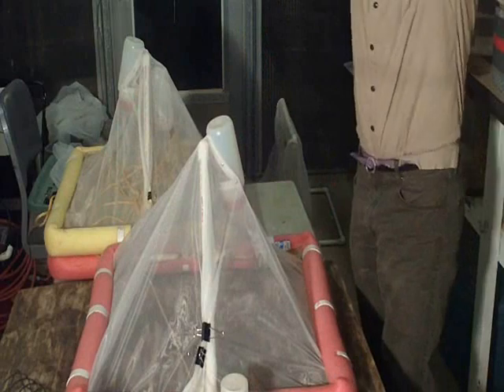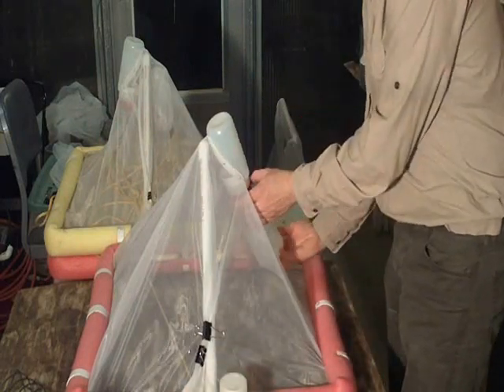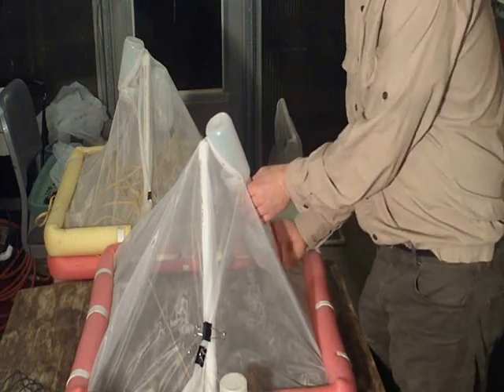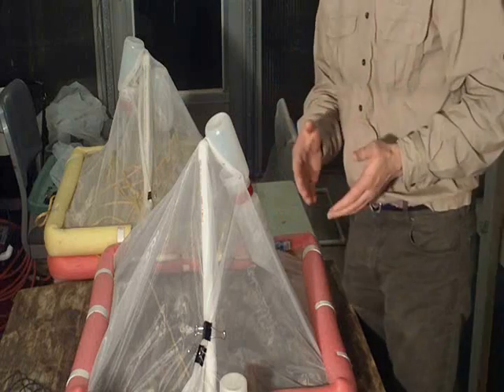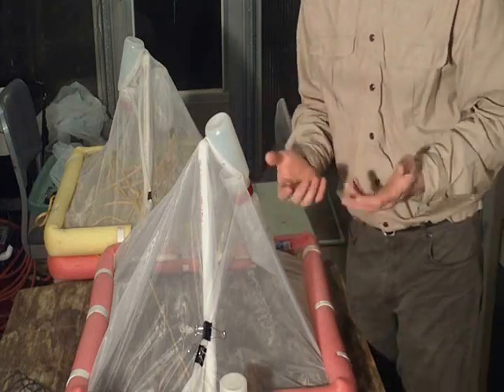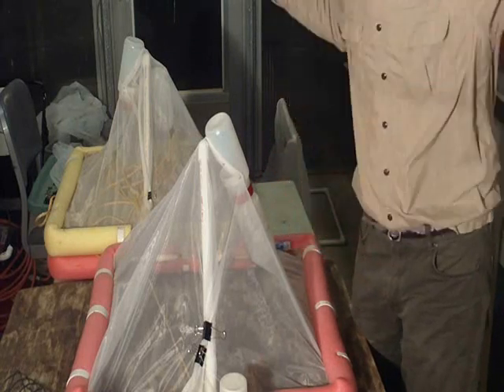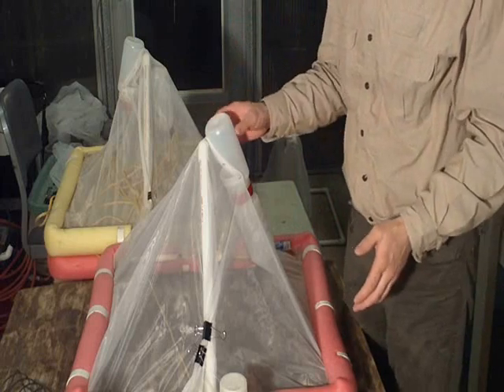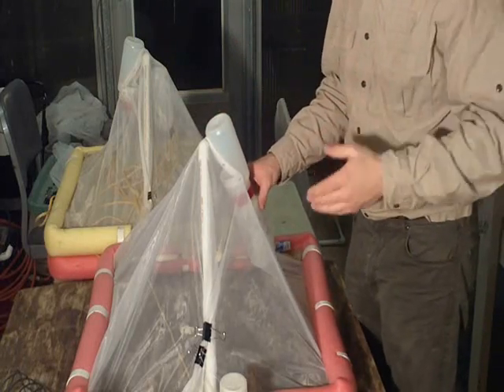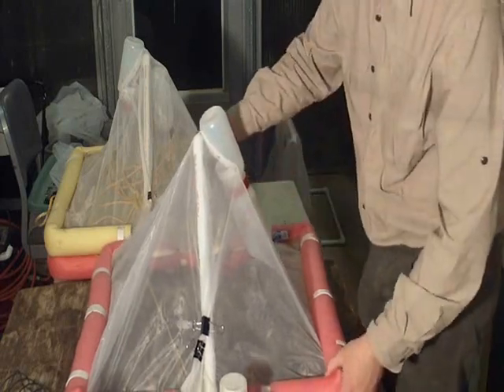And this has served us very well, but the big reason it works well is because it has a bottle trap. And Boris Kondratieff said, if you're going to do aspirations, you need to be sampling from 6 a.m. to 9 a.m. and have it done. At 10 minutes each, there was no way I could do it because I was having over 100 emergence traps spread out over 6 miles. So I needed a way to just either paddle or walk down the river and swap out the bottles. So this is what we came up with.